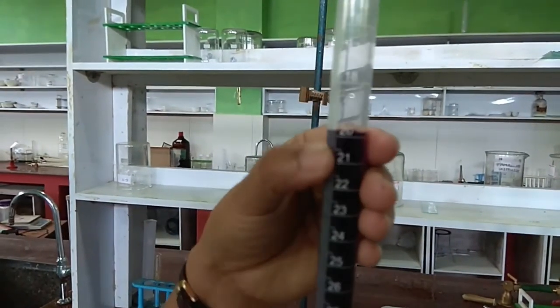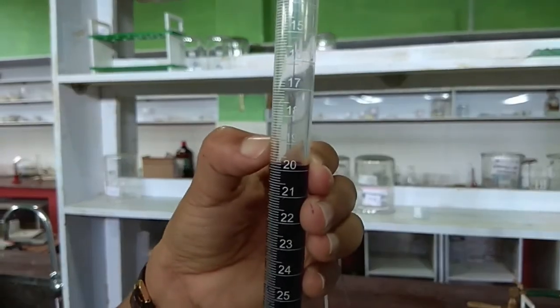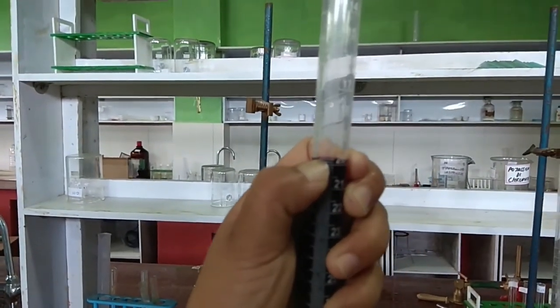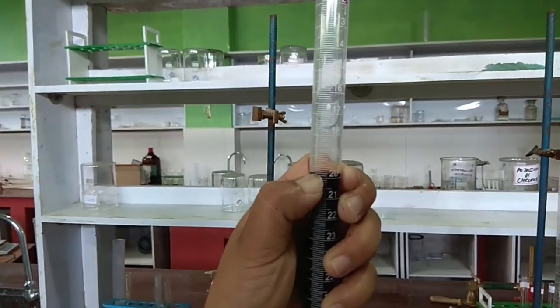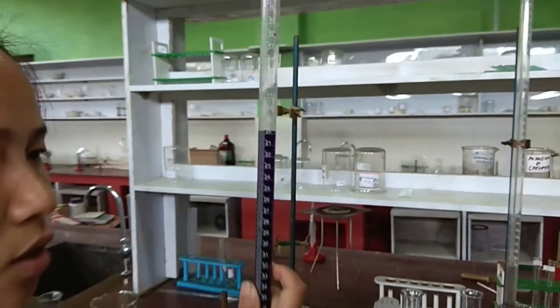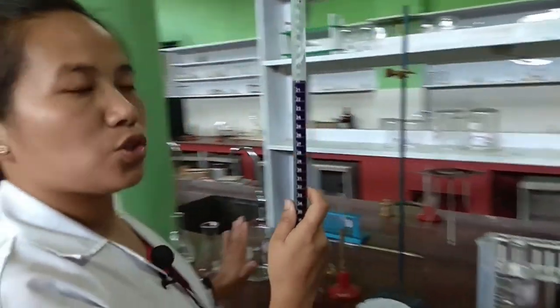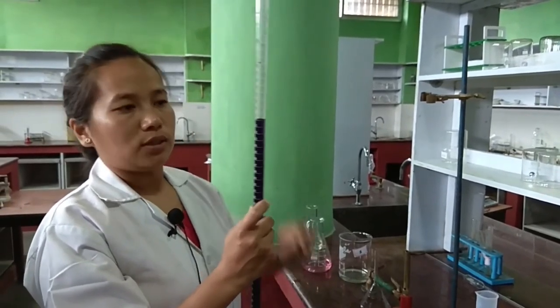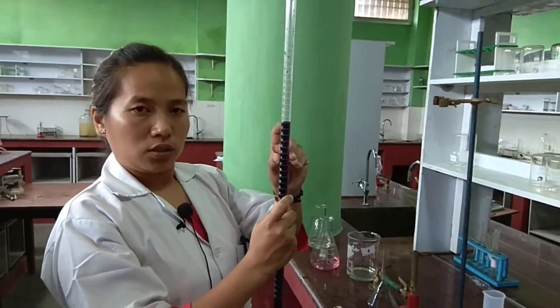The value is 19.8 ml, so the titre value for this experiment is 19.8. Similarly, take a second reading for the same solution, because you need at least two concordant readings during your examination. Repeat the procedure and again get one more titre value of the KMnO4 solution for further calculations.